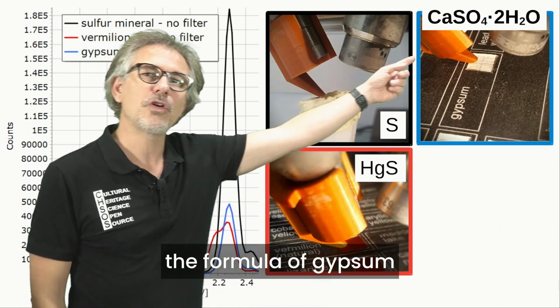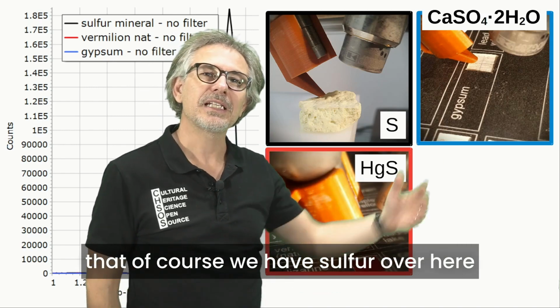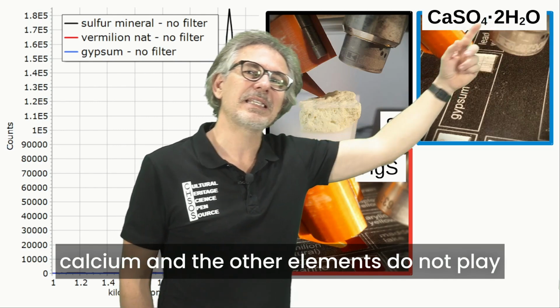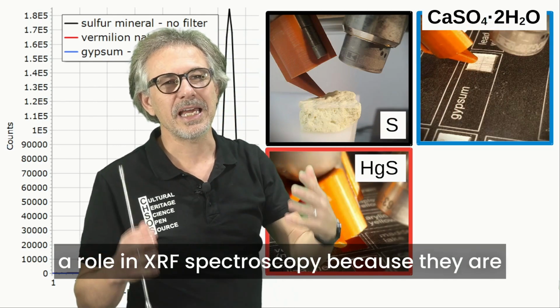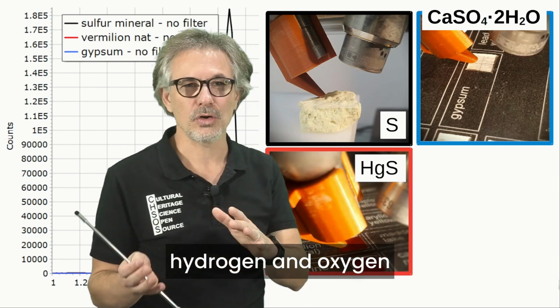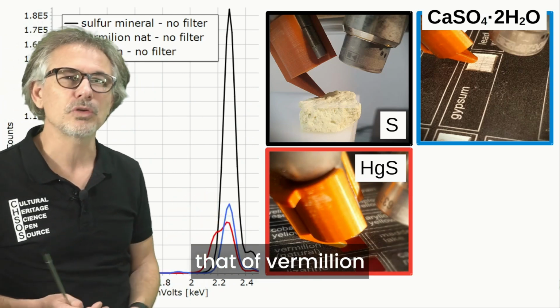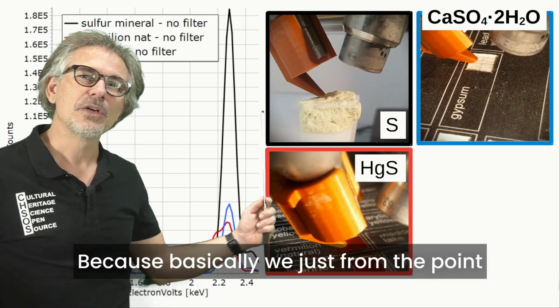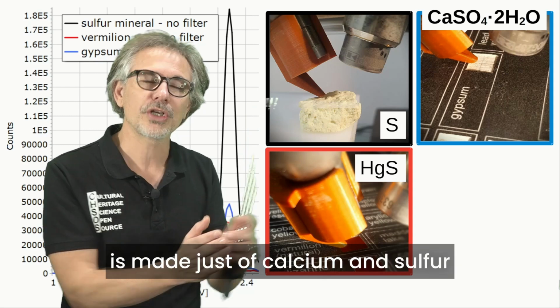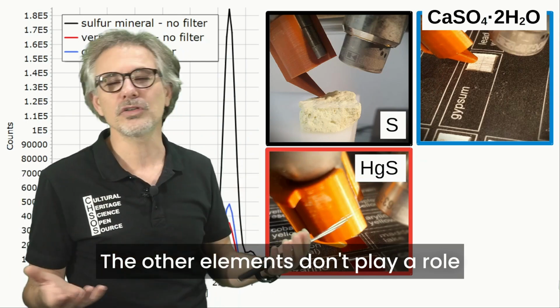We see from the formula of gypsum, a hydrated calcium sulfate, that of course we have sulfur over here, calcium, and the other elements do not play a role in XRF spectroscopy because they are low atomic number elements, hydrogen and oxygen. In the case of gypsum, we have a peak that is comparable to that of vermilion, because from the point of view of XRF spectroscopy, the molecule is made just of calcium and sulfur. The other elements don't play a role.